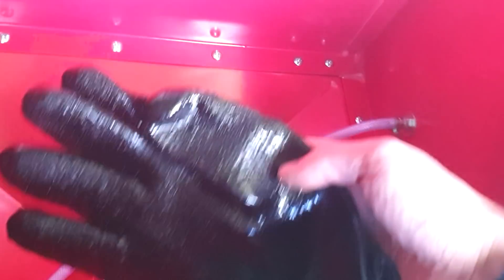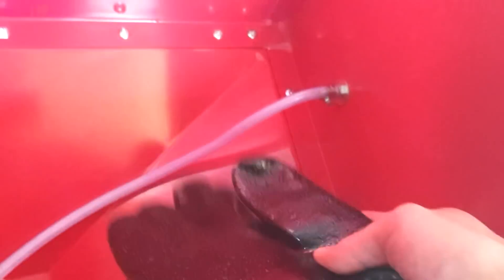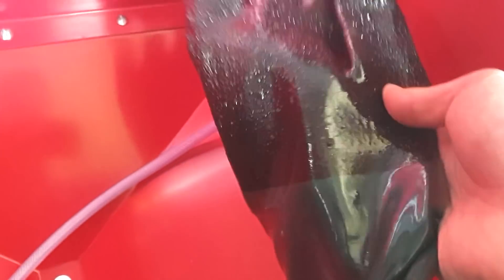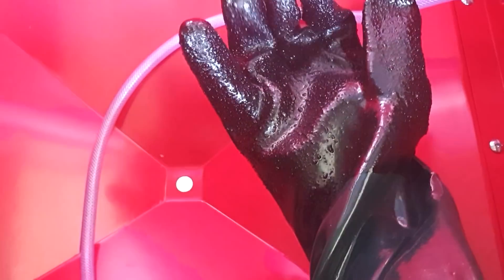The gloves are pretty thick material — they've got sand texture in there for grip. They're on there pretty well, held by a big hose clamp, which we can tighten but also allows us to change over the gloves in future if we get a hole or they start to degrade. I'm not sure if they're rated to actually hold in a gas rather than sand, so that gives us an option to swap in some nicer gloves when needed. They feel a little clumsy and I don't have much fine motor movement, but we'll make it work.